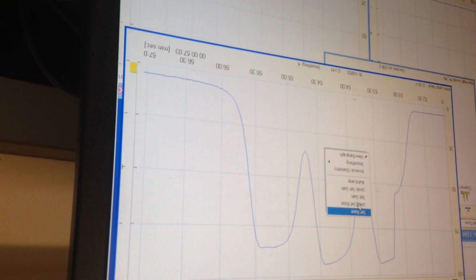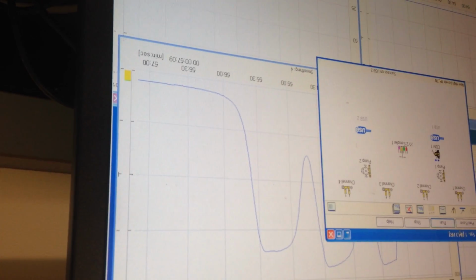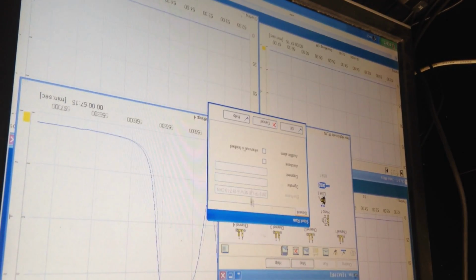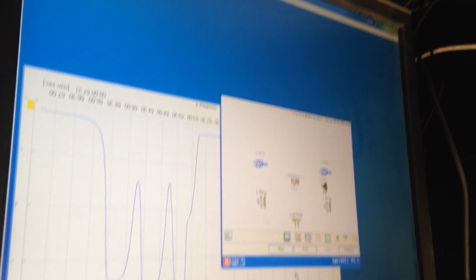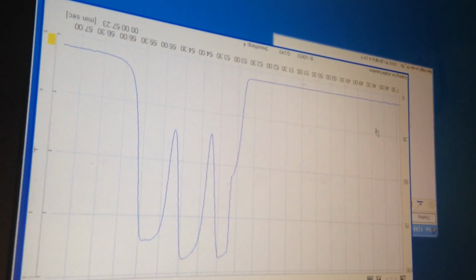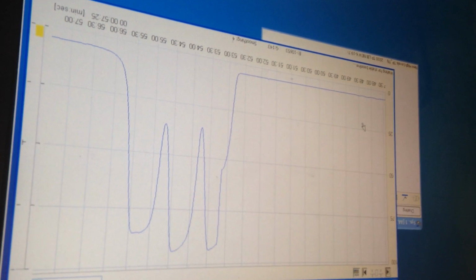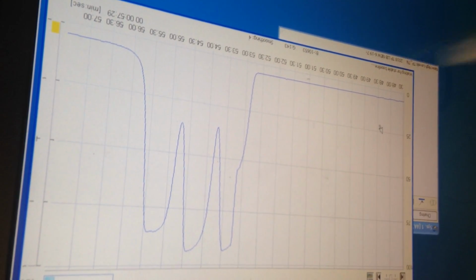Pretty good. So I'm just going to set base one more time. And I'm going to click on run. Find TP. That's it. Yep. The last thing, just before I walk away, is make sure that baseline is found. Yeah, baseline is found, and then the other. Yeah, and then so on.